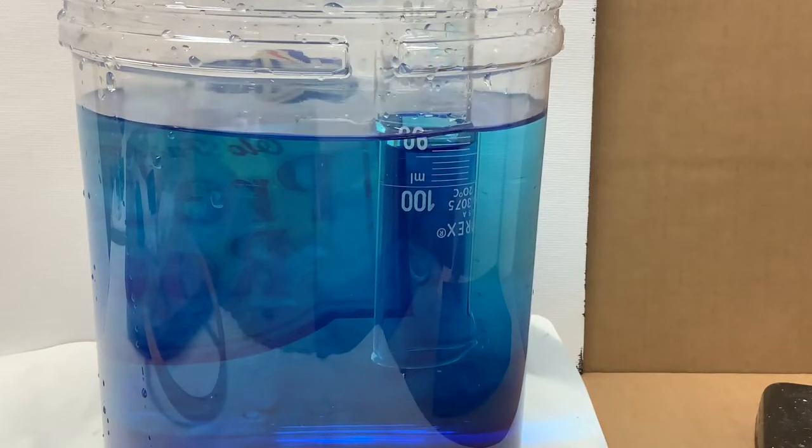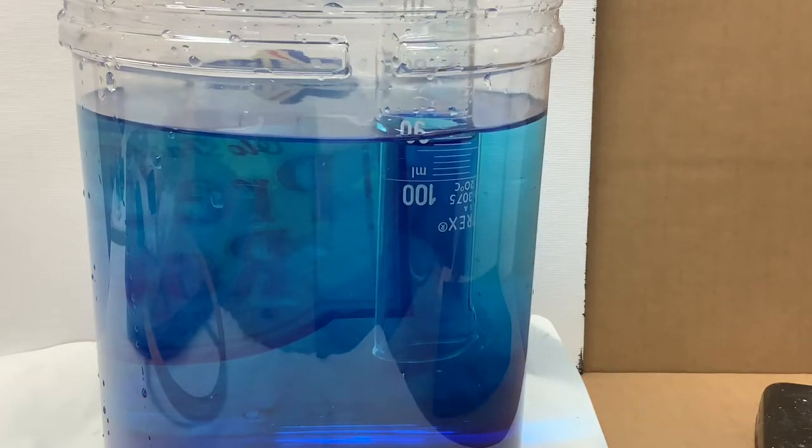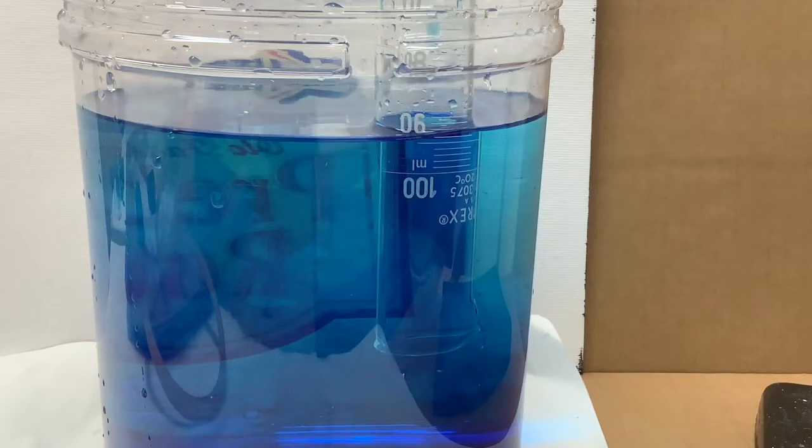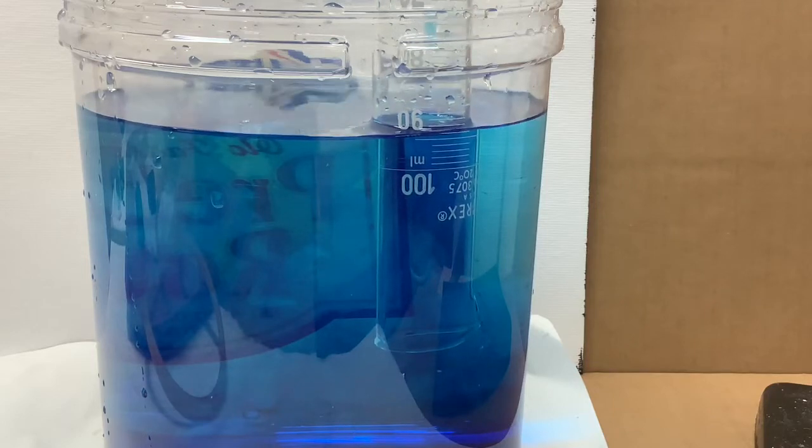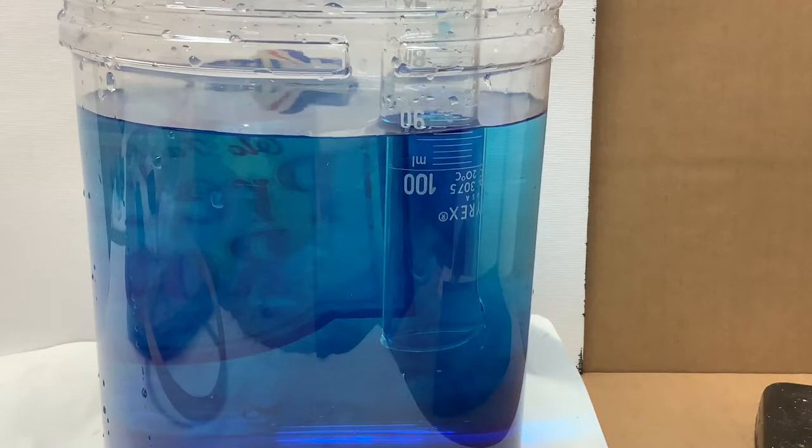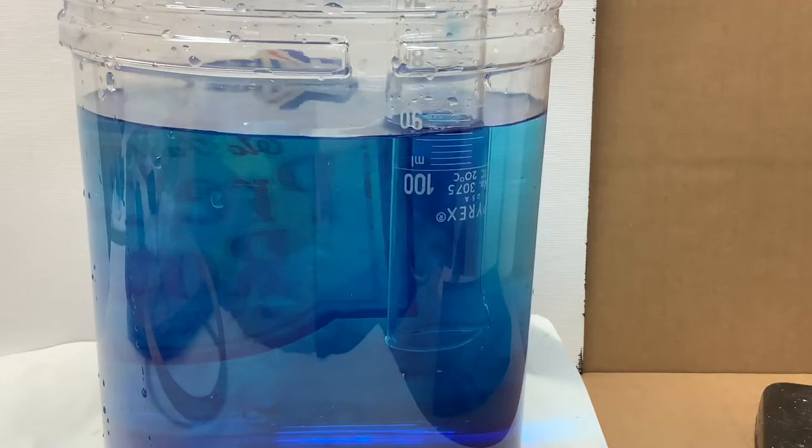So watch carefully. Make the best measurement that you can. And then stay tuned for a pressure reading and a temperature reading.